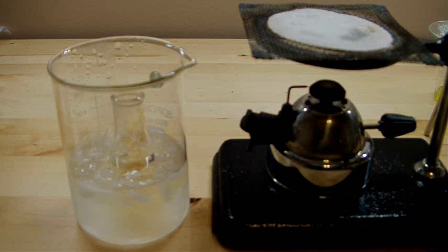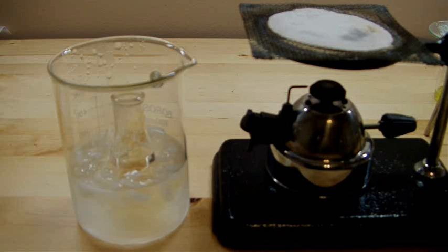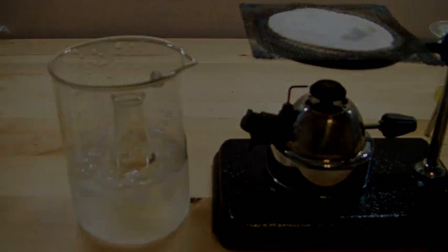And actually, now that I think about it, the color is probably due to the iodate precipitate just floating around in there. So once that settles out, I think everything is going to work out nicely. We'll let this sit in the ice bath for probably 15-20 minutes and we'll see how it looks after that.